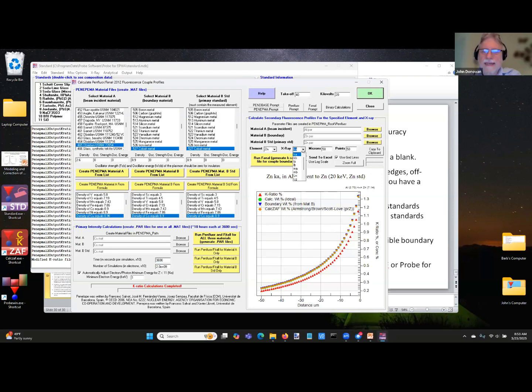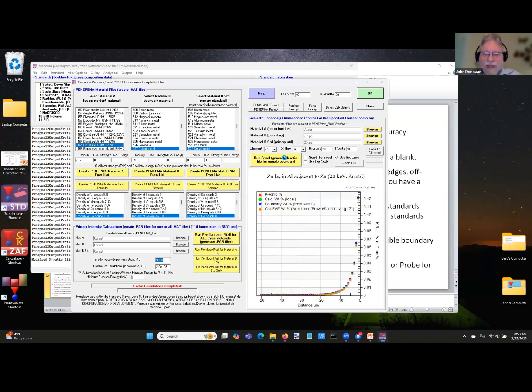But if I switch to the zinc L line, okay, so this is for the K line, zinc K alpha, in aluminum adjacent to zinc, and I change it to L alpha, and now let's run it with the L alpha line. And you see it's much, much, much smaller. It's basically 1,000 ppm instead of 10,000 ppm. So you can mitigate it to some extent, yes, by choosing different conditions.